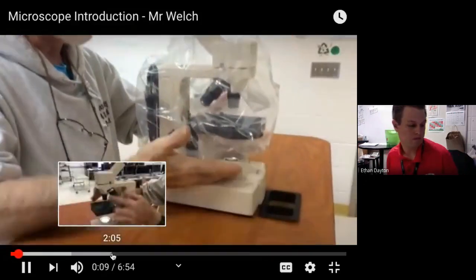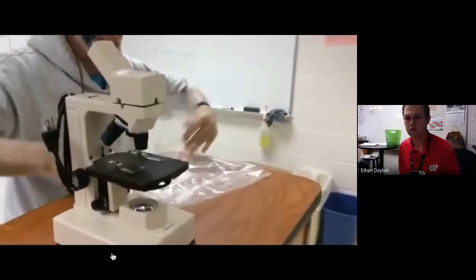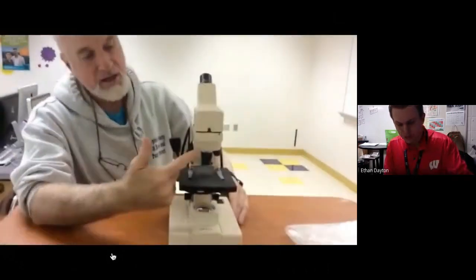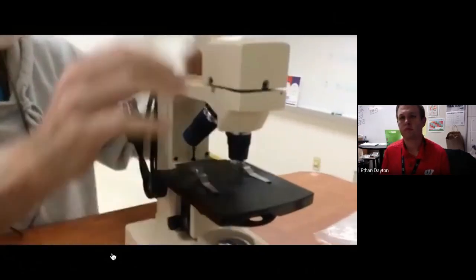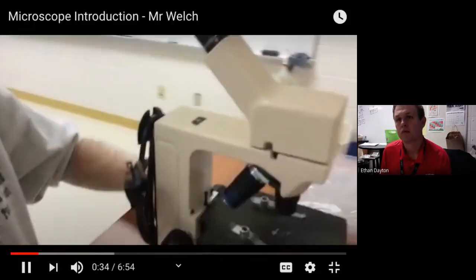Your microscope should look like this. It should be stored away with the cover over all glass and above the base and below the stage. When you take the cover off, and you fold it neatly, and you set your cover aside. The microscope, if it was put away properly, should be in low power objective. The stage should be all the way down. The eyepiece that is movable should be over the arm of the microscope.